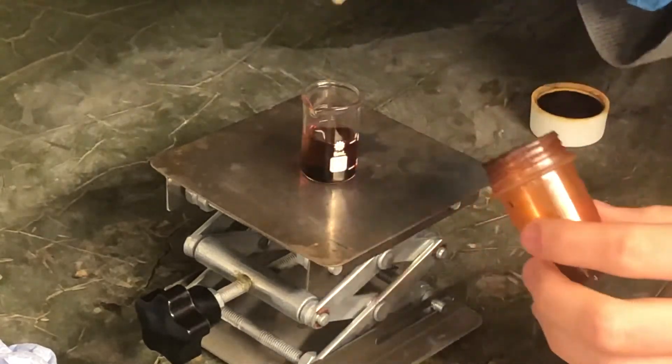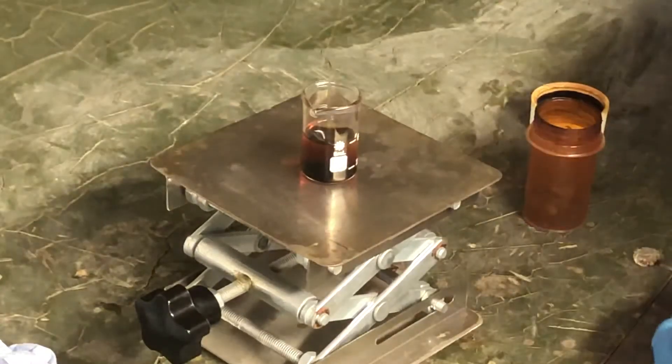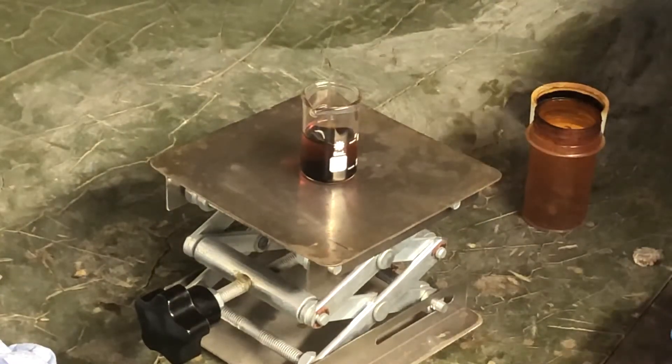You know what, I've actually forgotten the acid catalyst, but it seems to be working just like that, which is interesting.